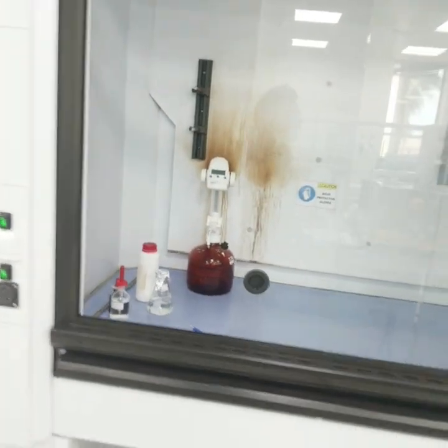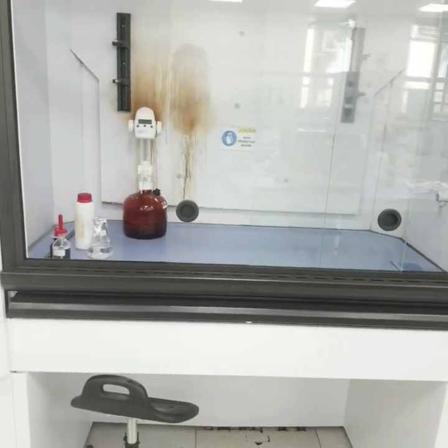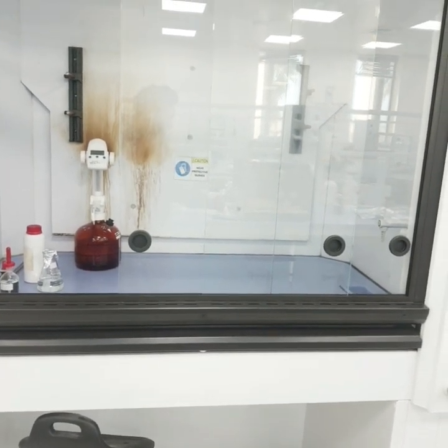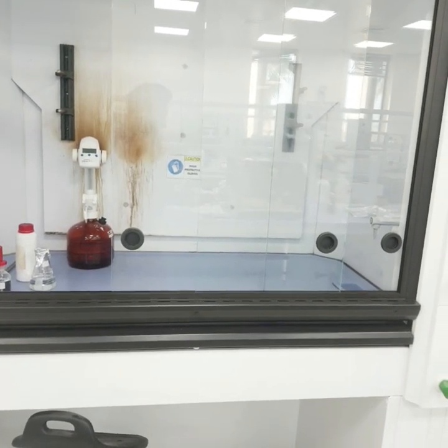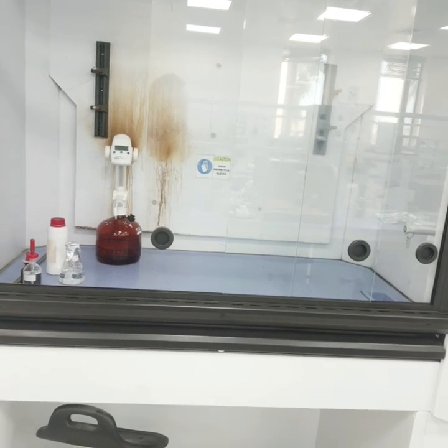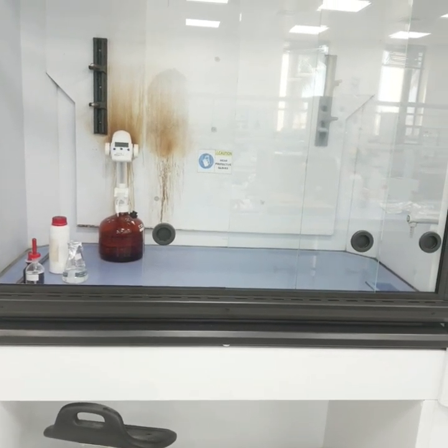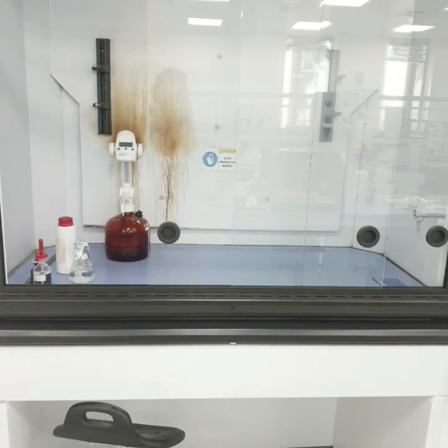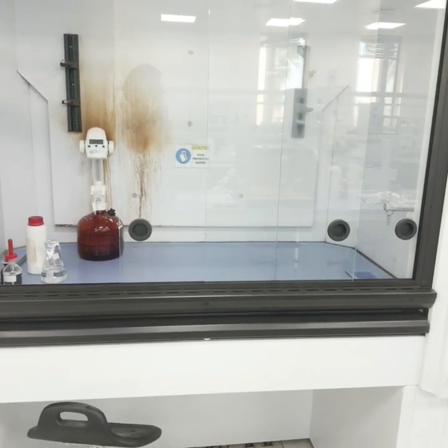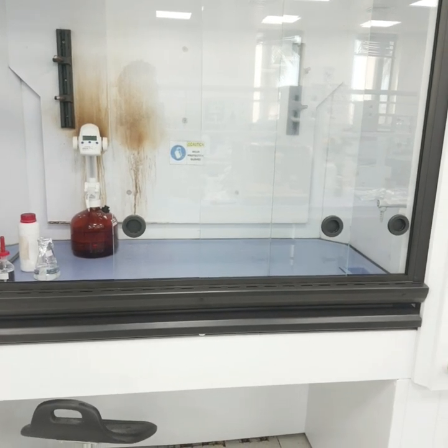Hello friends, today we are going to talk about the term fume hood. We will be covering the fume hood definition, its types, how it works, what the air requirements are, and what the sash height should be and how far away from the fume hood one should stand.